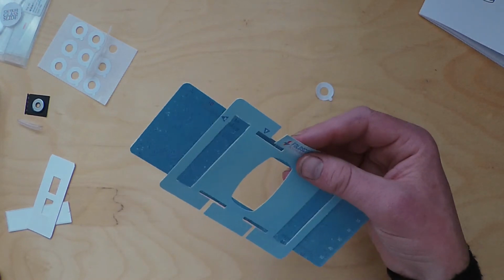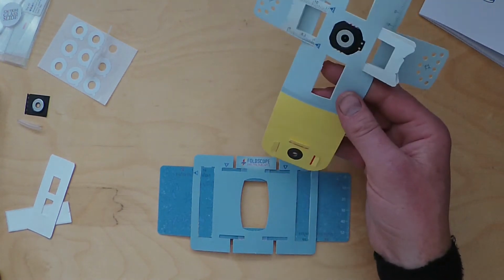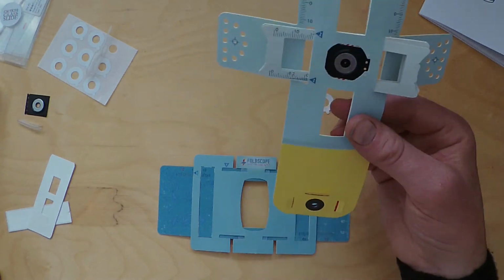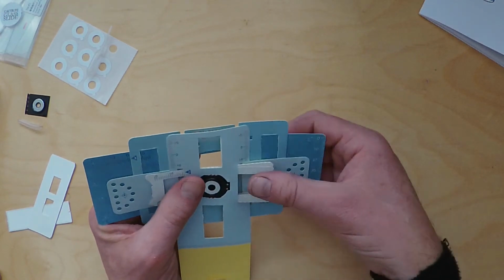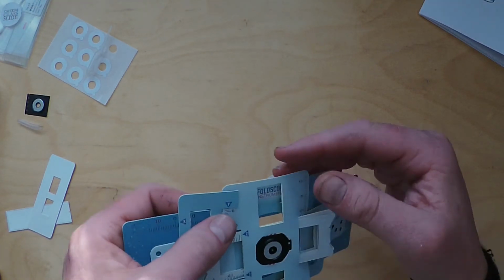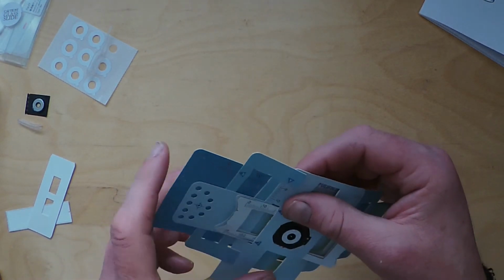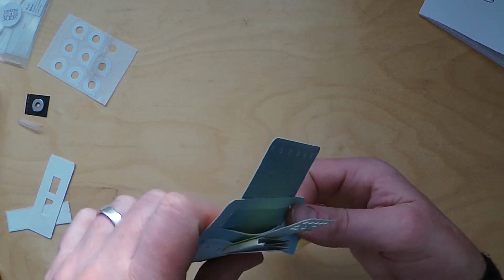What you need to do is get your lens stage. Yeah, so what we need to do is place that like so. What you want to do is pull these bits forward so you can see the Y becomes visible over the numbers there. And another tab there, tuck that in there. Same on the other side, so snap that forward, snap that forward.